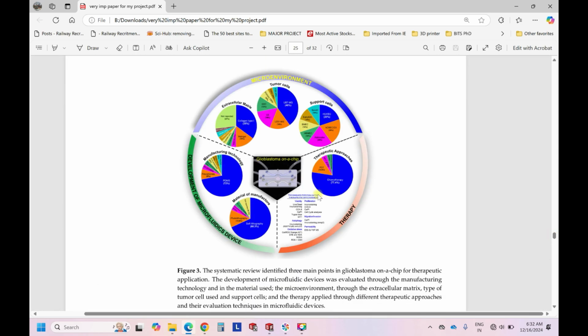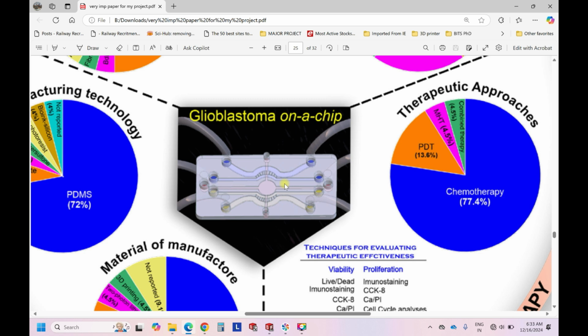So this is the design that we are going to target today. It is a glioblastoma on a chip design. If you see, there are 1, 2, 3, 4, 5 inlets, and similarly 5 outlets, and there is an intersection crossing from left to right or bottom to top. You can decide. Once you see this design, it looks pretty complex when you have this kind of curves. It is common for a beginner or for someone who is enthusiastic to do microfluidic channels, but they face difficulty in designing their own channels. So for them, it looks complex. So let's see how to design this complex chip in a simple way.